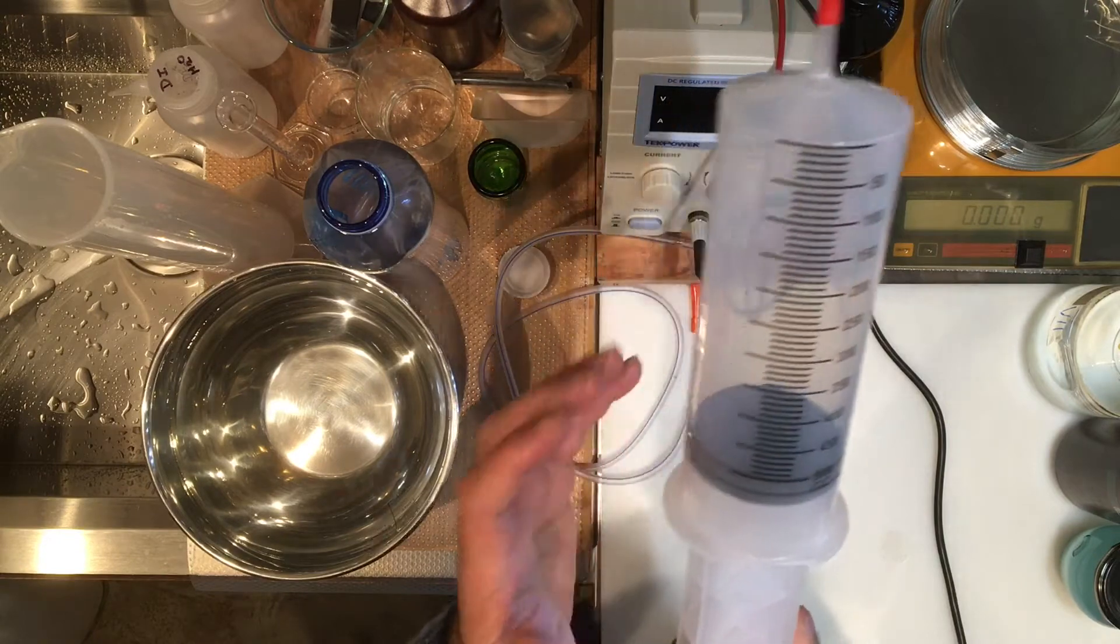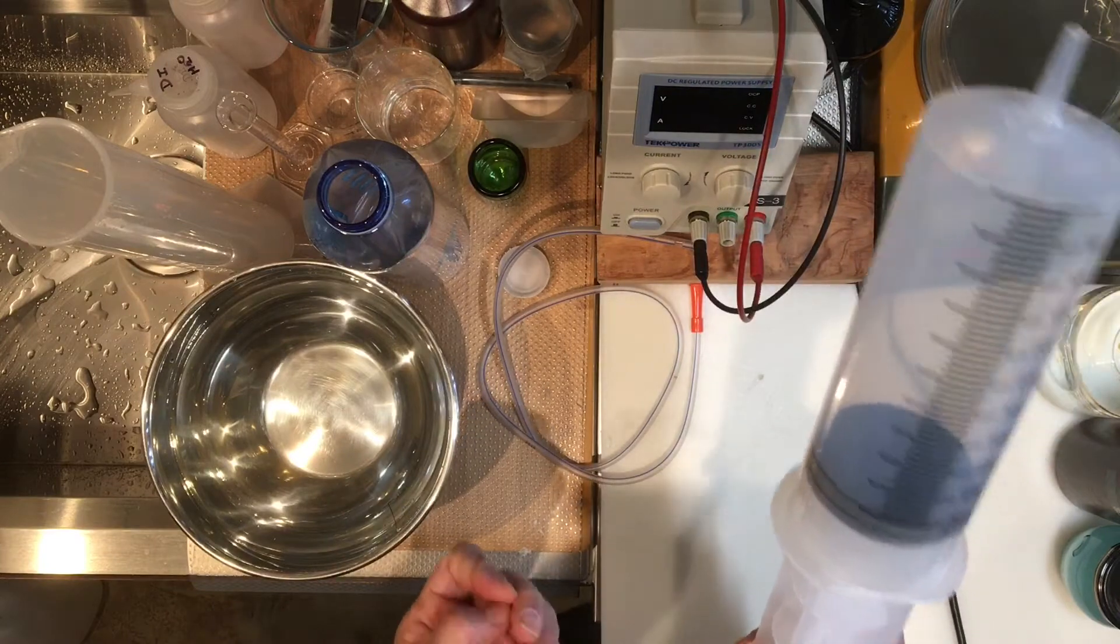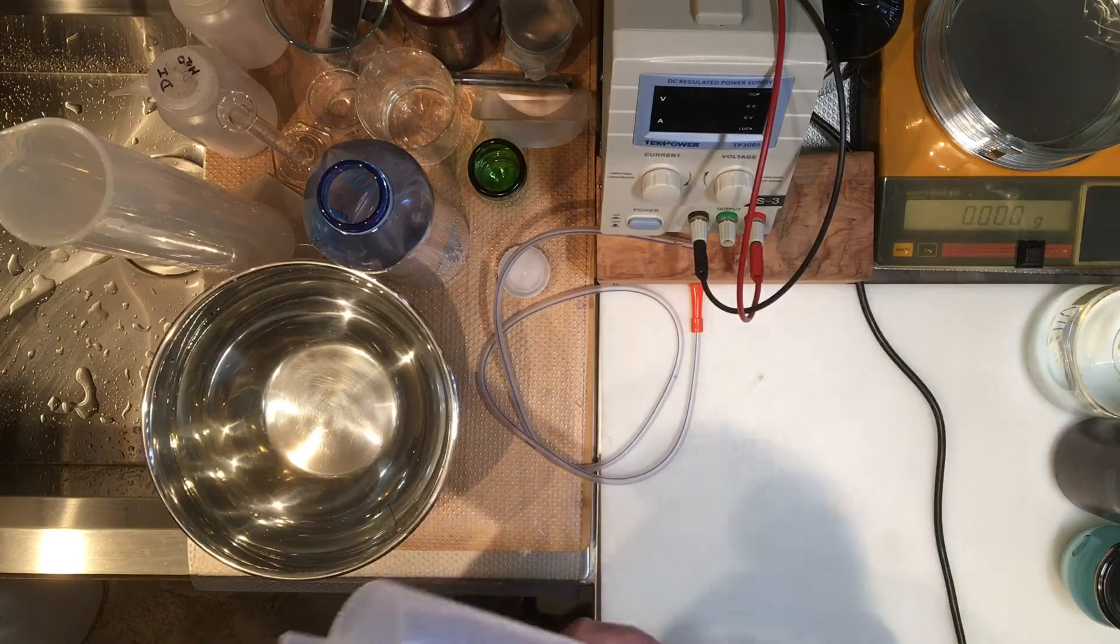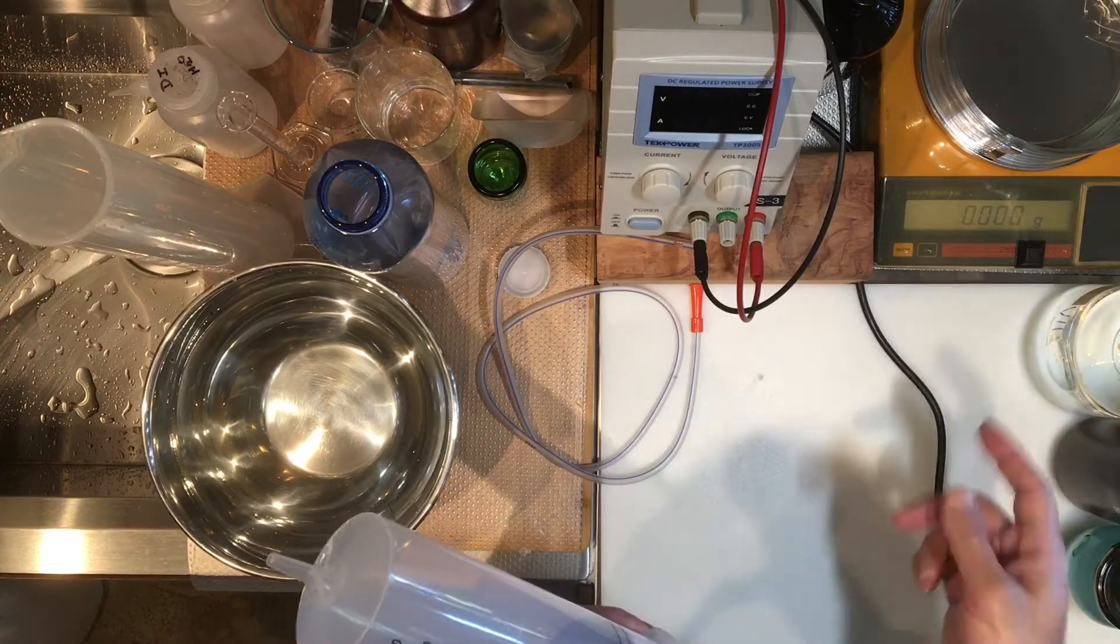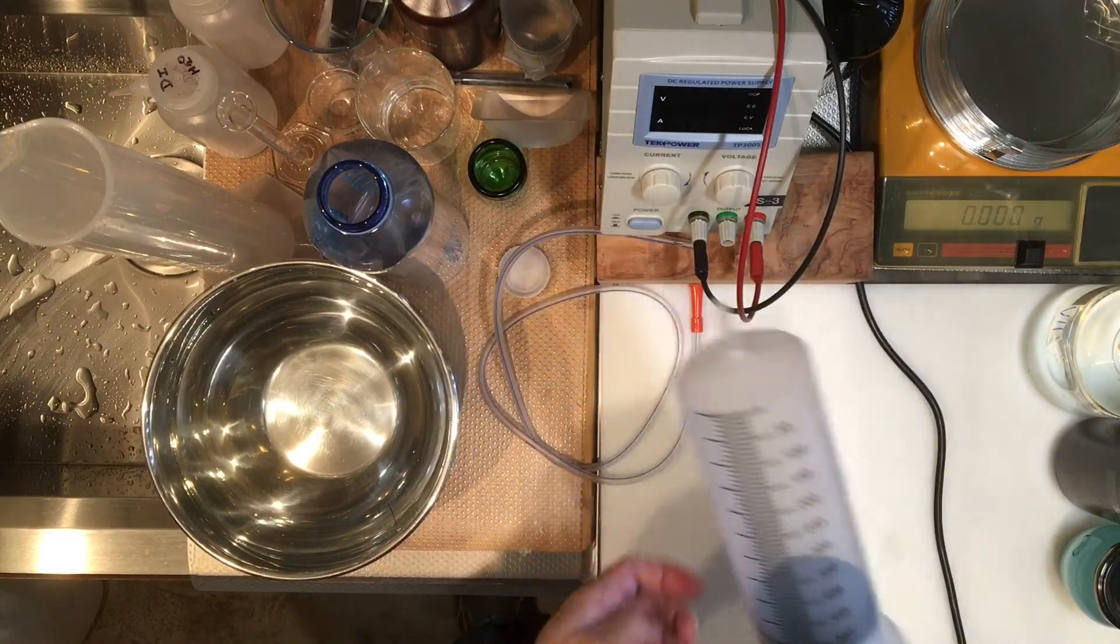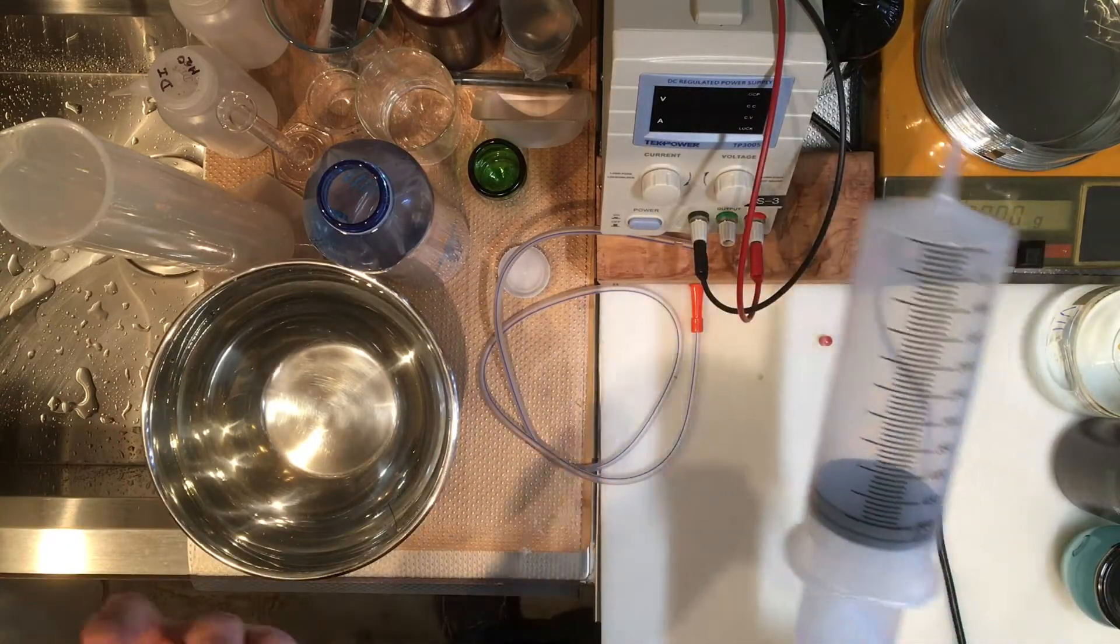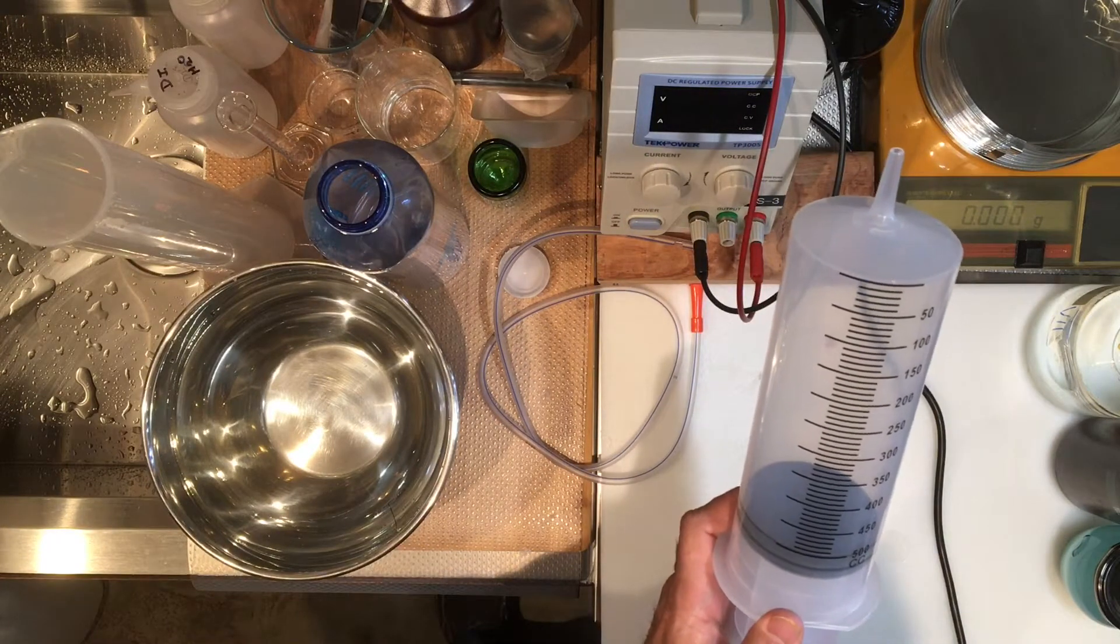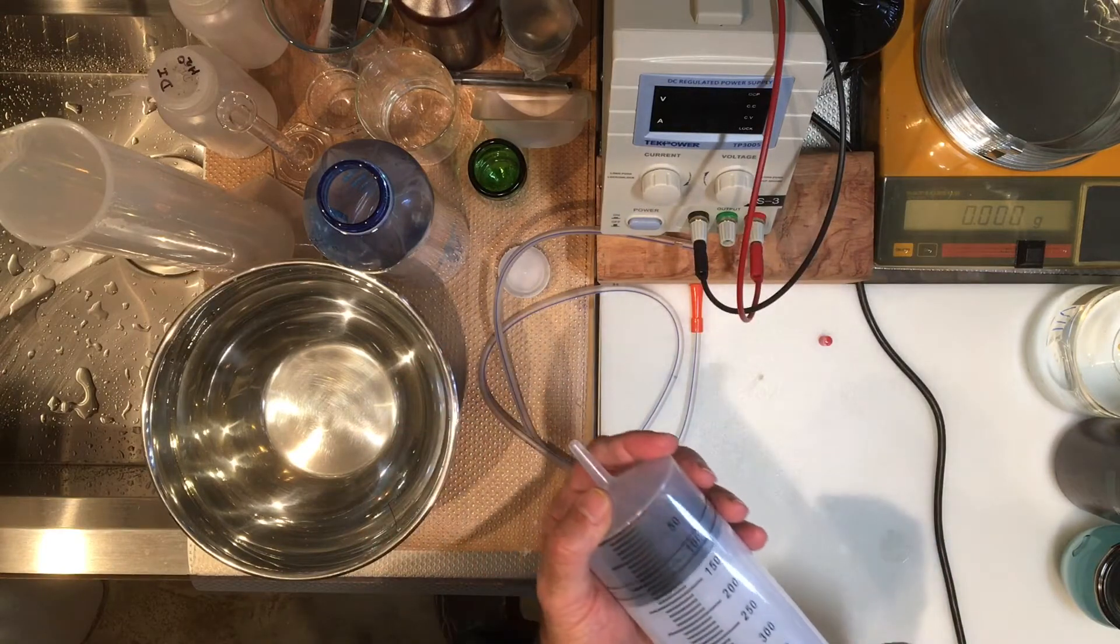Mass measurements are actually more reliable than volume measurements generally because the precision of balances are pretty good. I can probably get like five, four sig figs at least of measurements on this. I haven't done this before, I'm going to just do it with you guys, mainly for lack of time, and I want to get this video to you as soon as possible. We'll try to work it out.